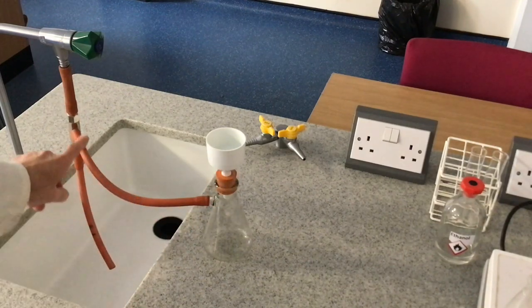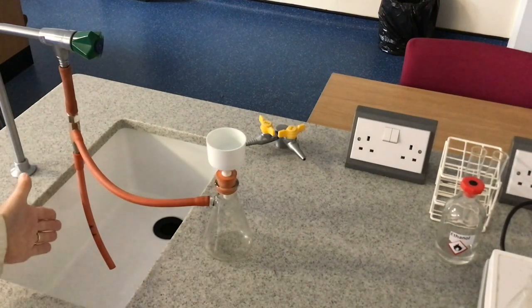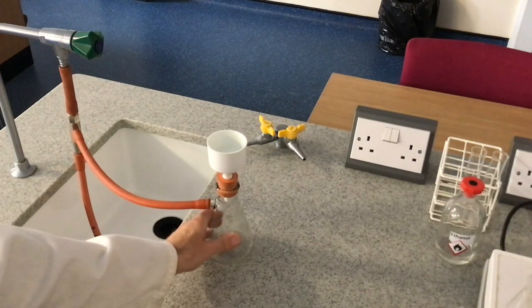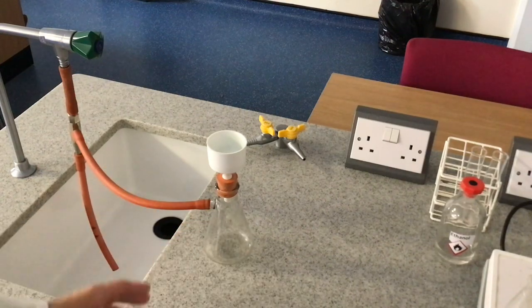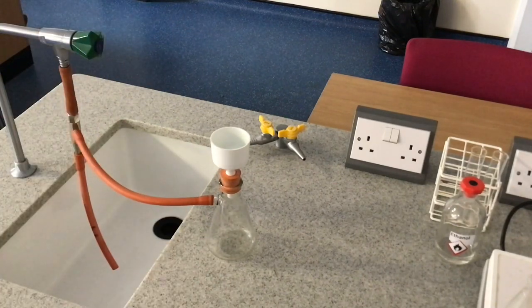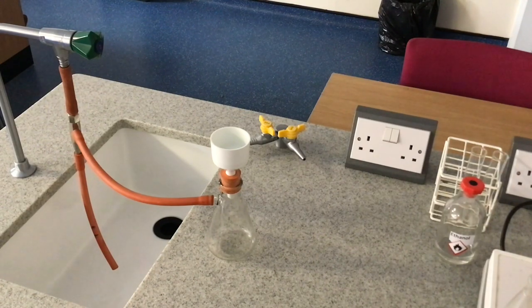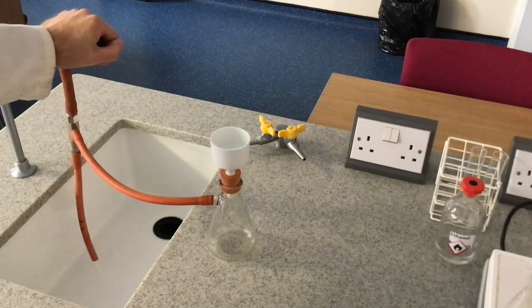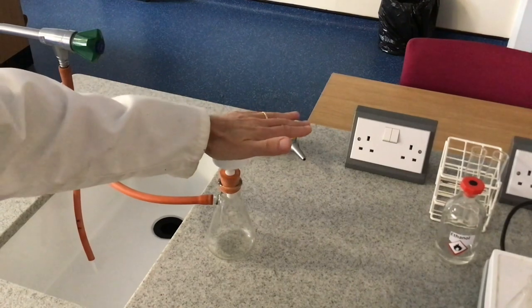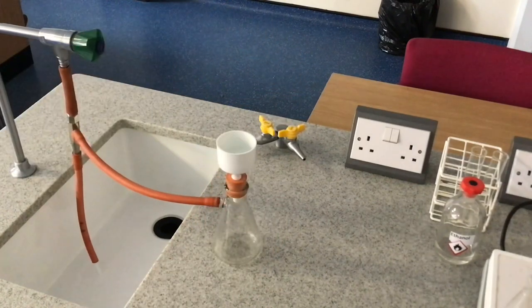This rubber tubing here goes to the water pump. The action of the water running through the water pump reduces the pressure inside this flask. So you've got a pressure gradient — high pressure outside, low pressure in here — and that forces the liquid down. That makes it more efficient and a quicker way of filtering than regular filtering under gravity. I'll just demonstrate that now — you can see it's quite a powerful suction there.